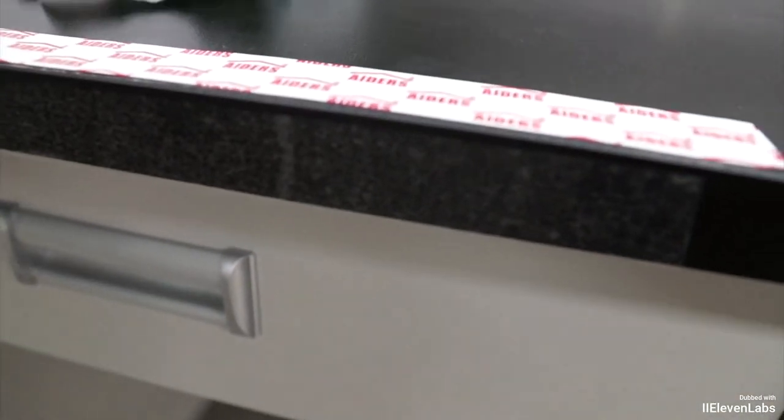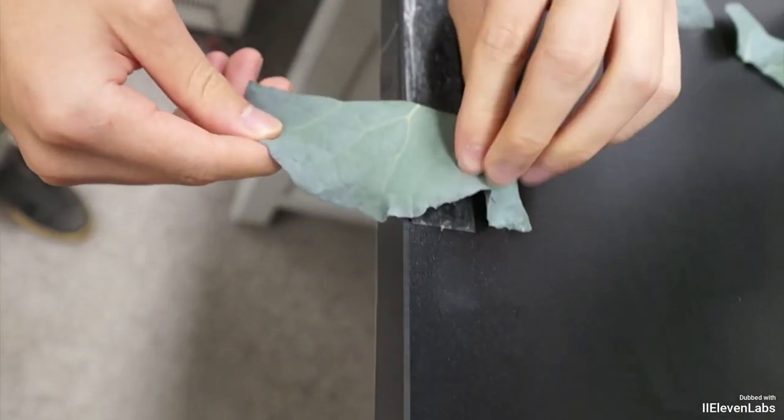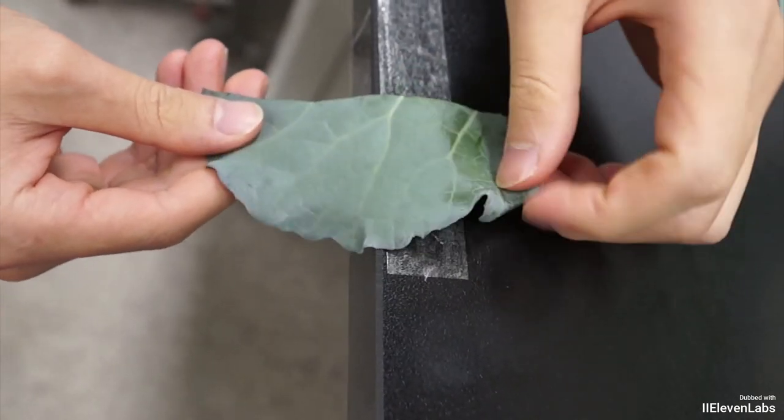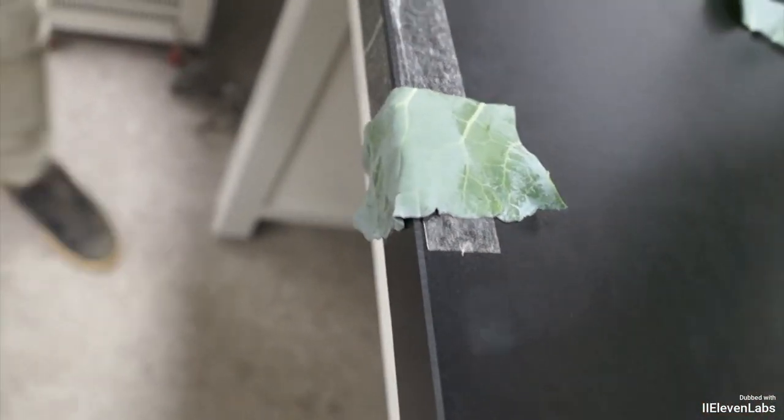Stretch the leaves as much as possible, pulling slightly harder than shown on the screen to flatten the leaf surface and ensure it sticks securely. It is important to avoid touching the edges of the leaf surface on the table to prevent disturbing the epicuticular wax during the experiment.